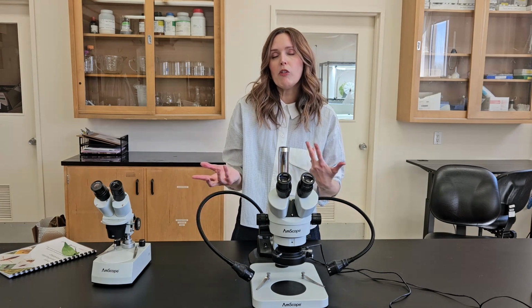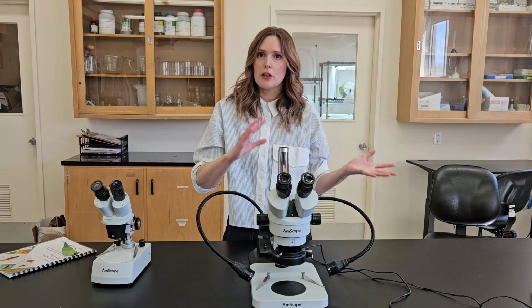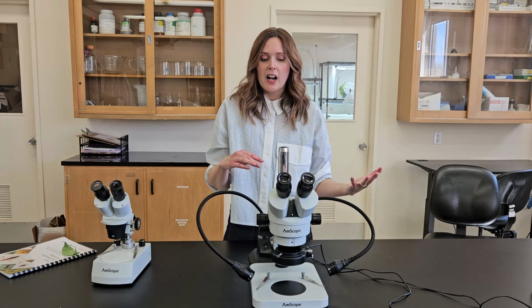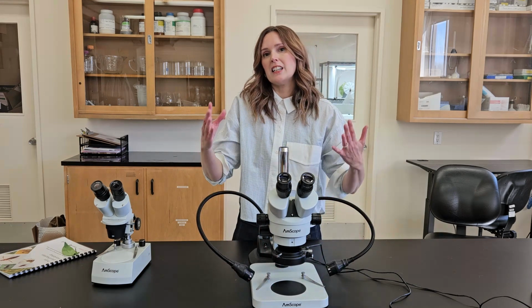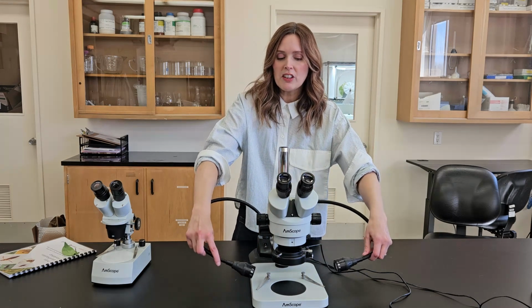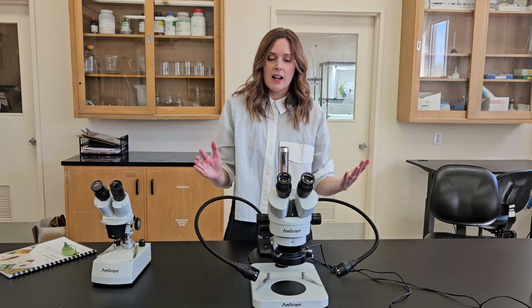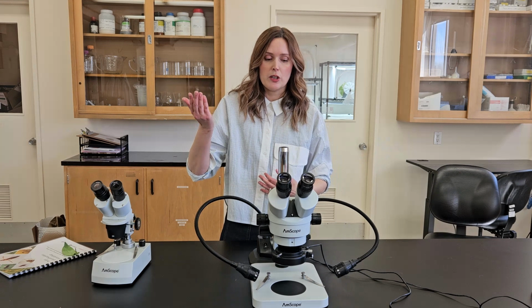Like we find it helpful for sticky cards that we've wrapped in saran wrap that we want to look at thrips species afterwards. If you use this ring light that shines directly on it, it can be too reflective and it's too hard to see what's going on. But if you come at the light from the sides, you get enough light to see what you're doing, but it's not shining straight back into the microscope.